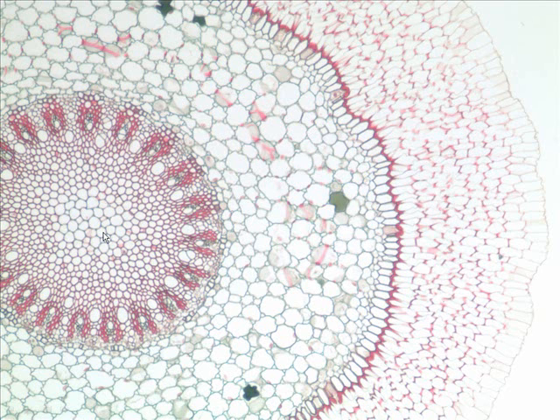Then we come to this region here. What tissue is this? We just looked at it in the last slide. It is what kind of tissue? Parenchyma. What do we call this region? Pith. And so we have cortex out here and pith. Again, some people call this velamen the outer cortex, and then this the inner cortex. We'll just work with this part right here and call it the cortex.